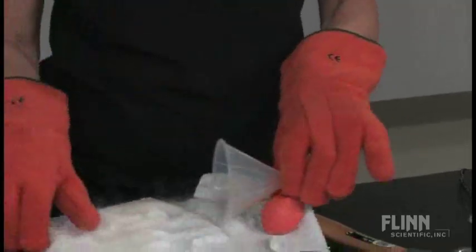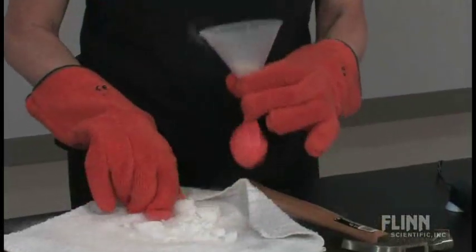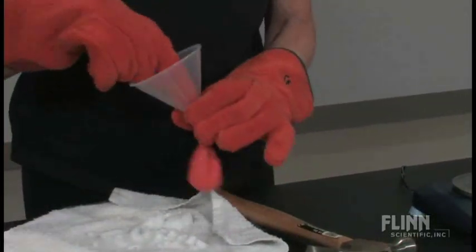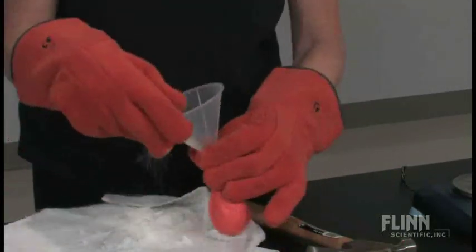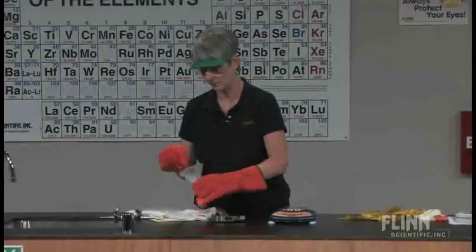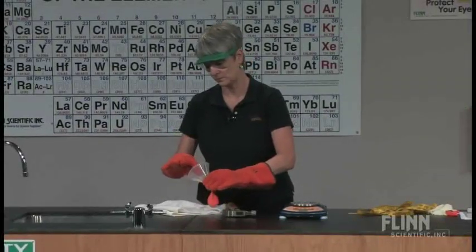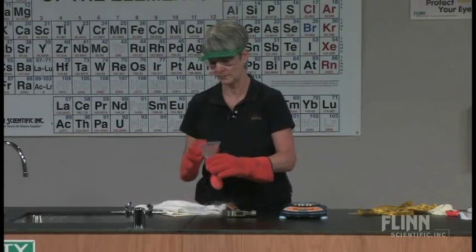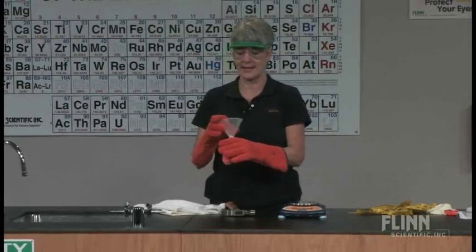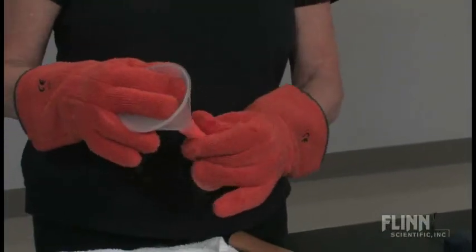The big pieces aren't going in very well. I've got quite a bit of dry ice in there now. The larger the volume difference I can get in the balloon, the better my data is going to be — that's the reason I'm putting so much dry ice in.